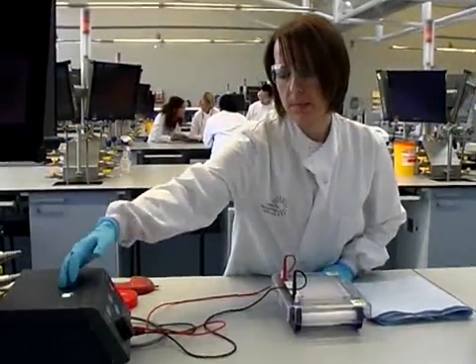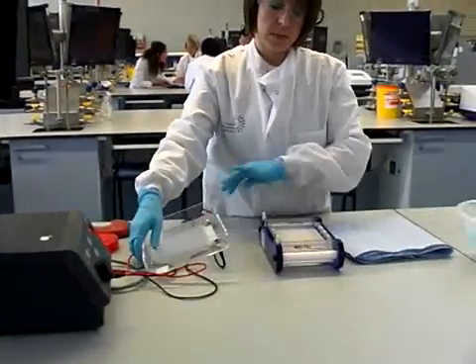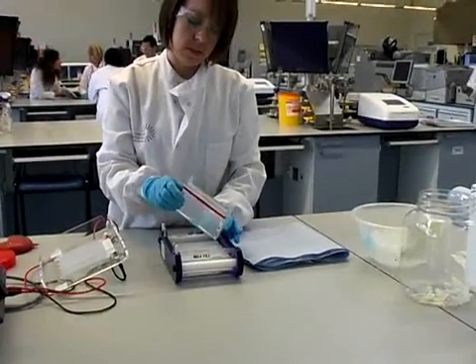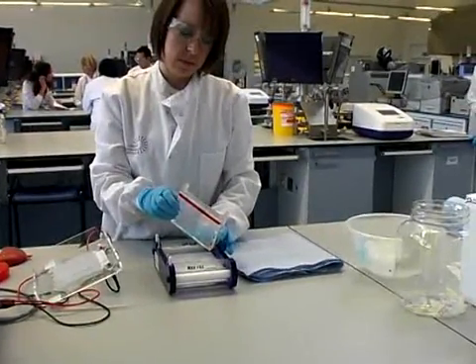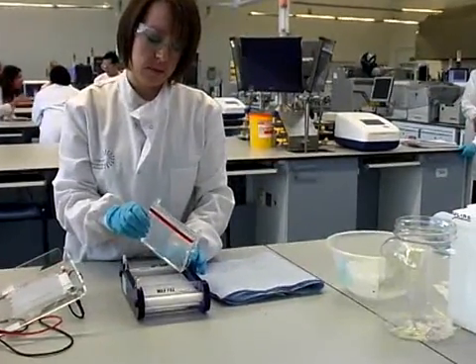Once the gel has run its course, the power supply is switched off. The lid is removed from the tank and the gel is removed. The excess buffer is allowed to drain off and then it is placed on some tissue paper.